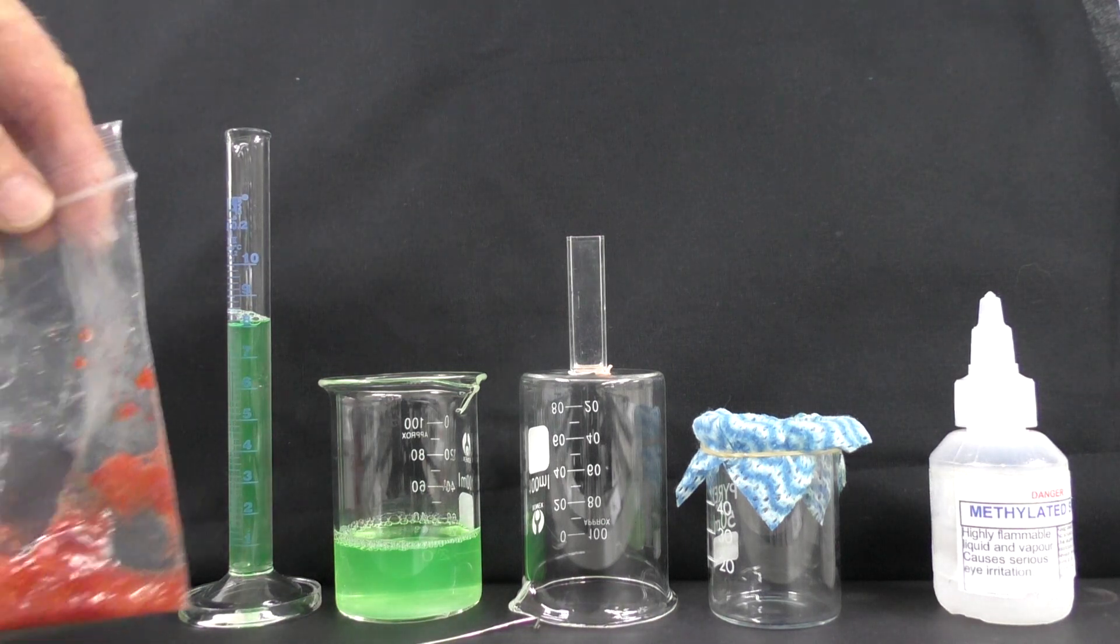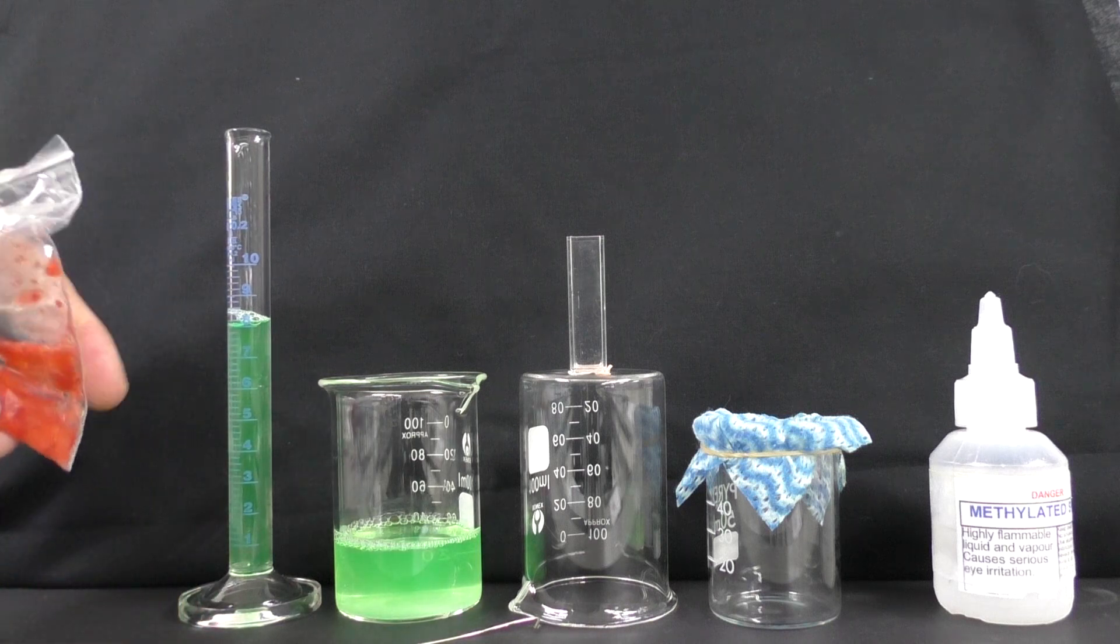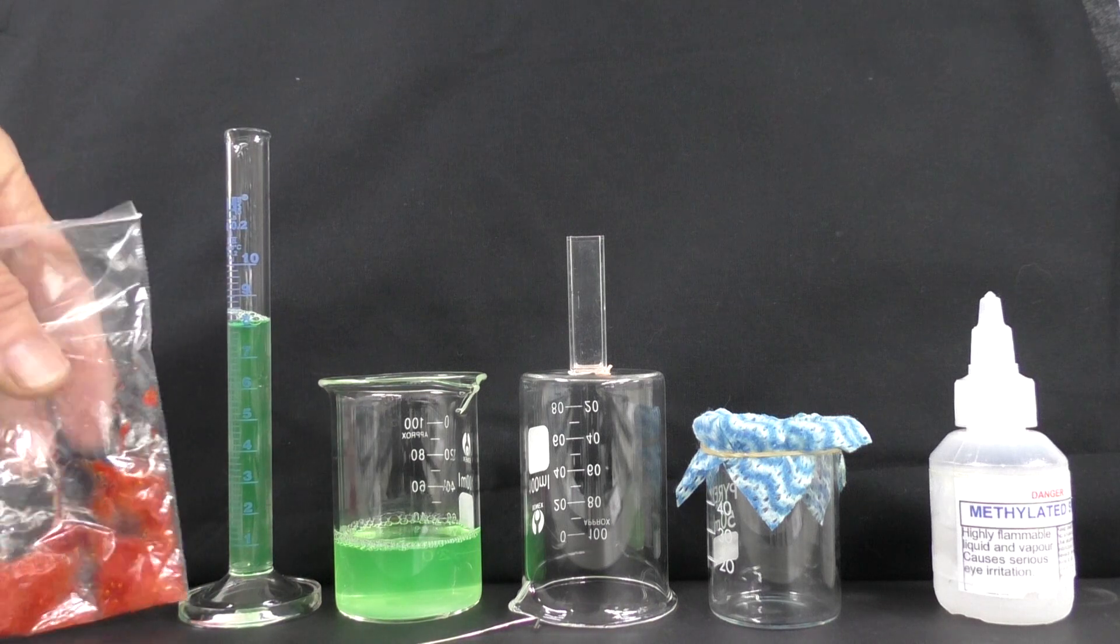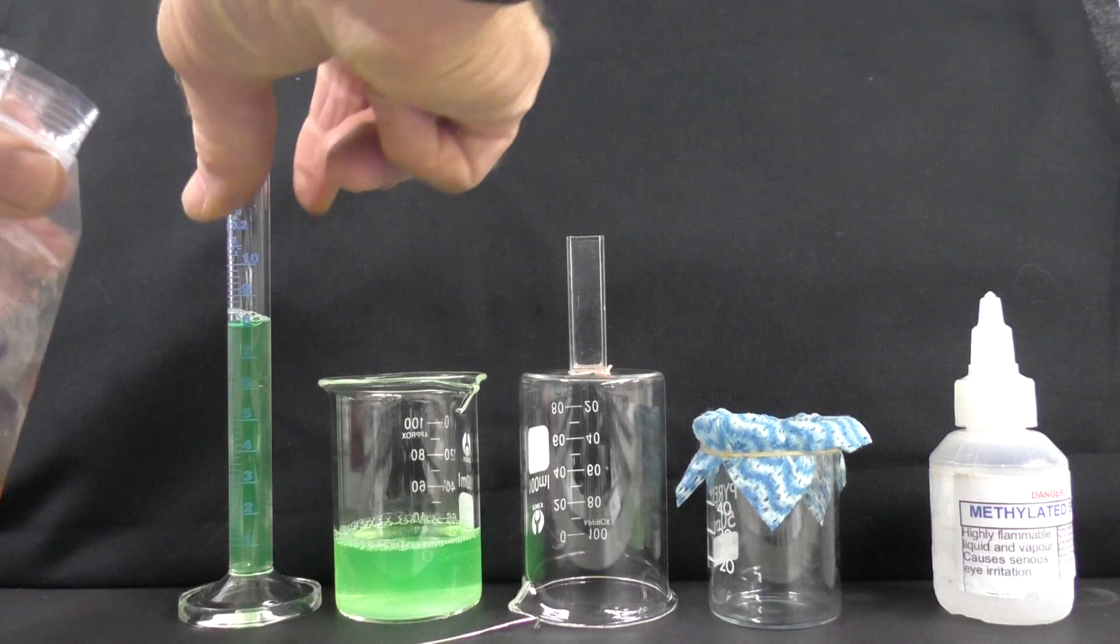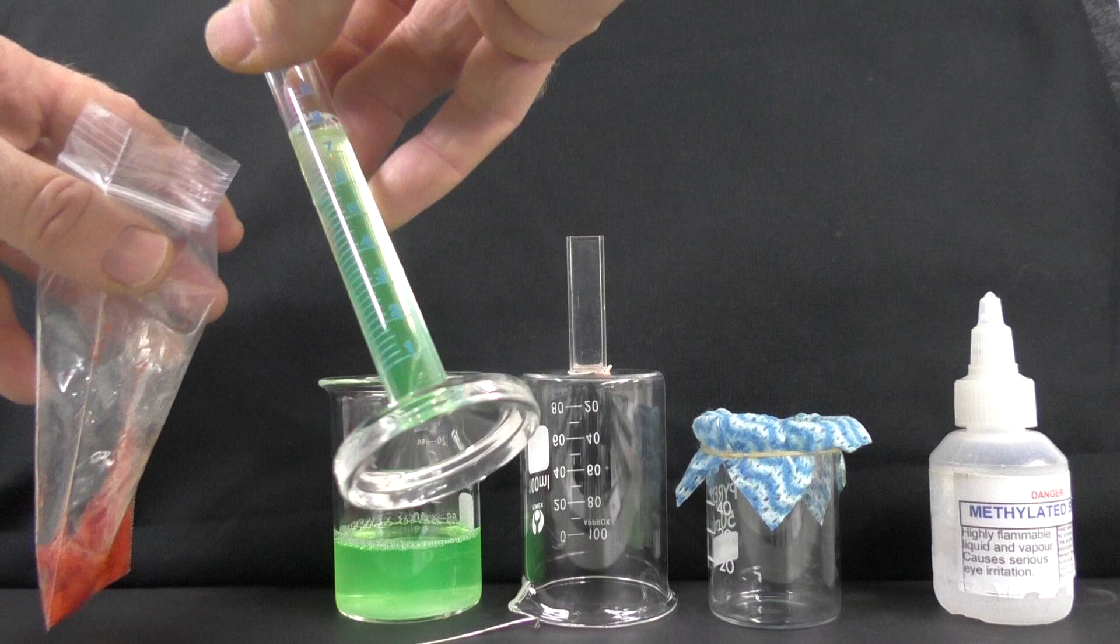We've now been mashing for five minutes and we've got a nice soupy mix here of our strawberry. We're now going to add some of our salt and detergent mix into here.